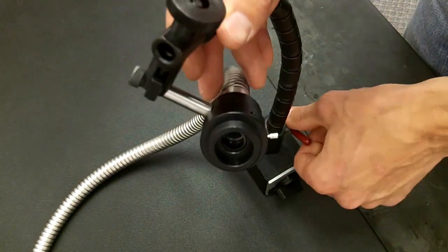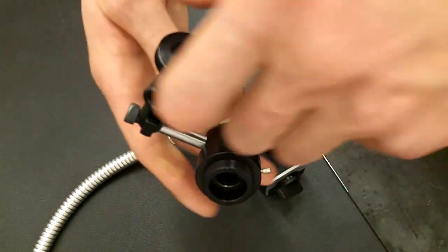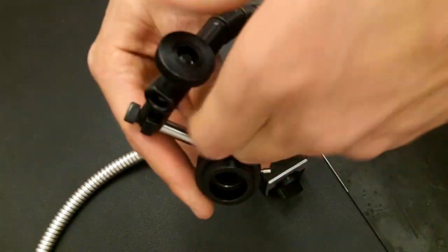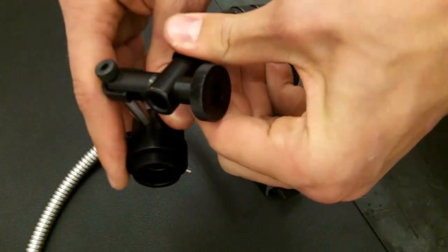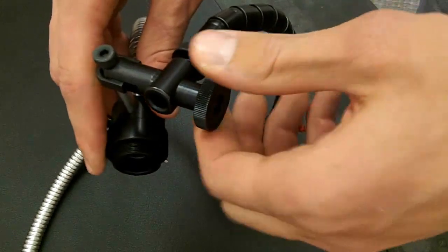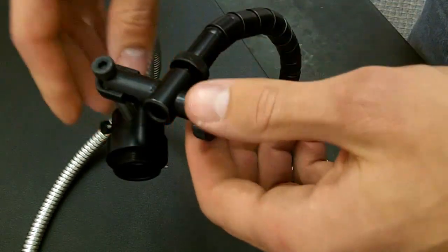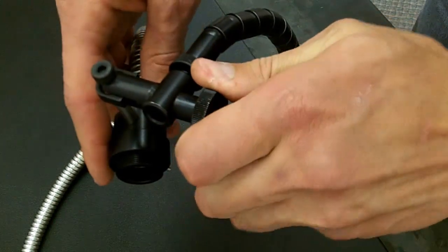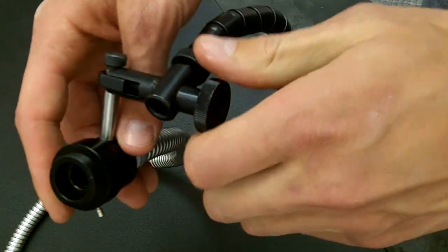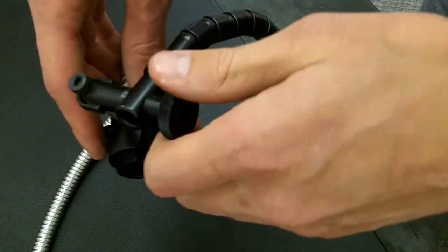This screw up here allows you to make several fine adjustments to where the fiber optics are pointing in relation to your specimen. You can move it up and down and point it in any given direction by loosening and tightening this nut.